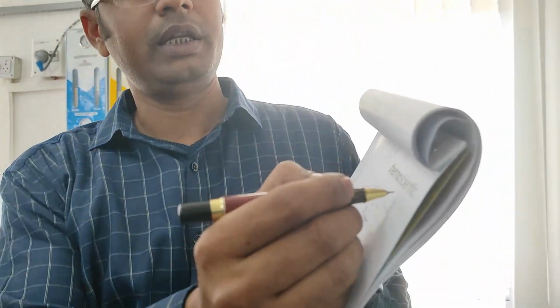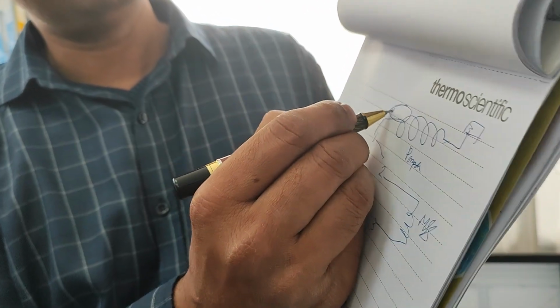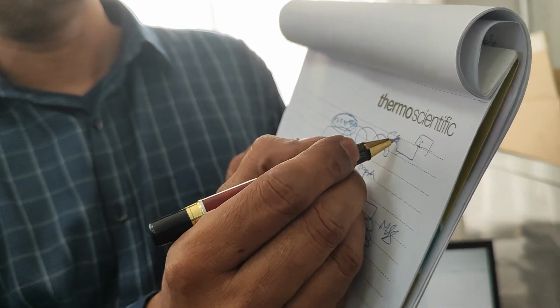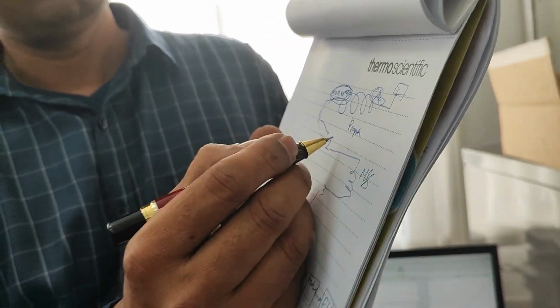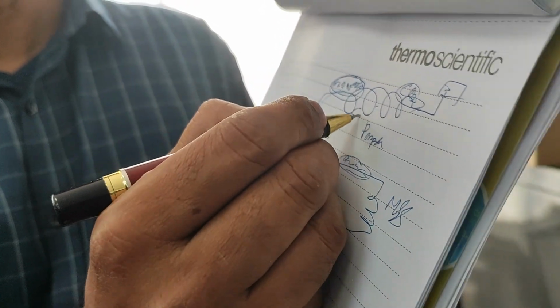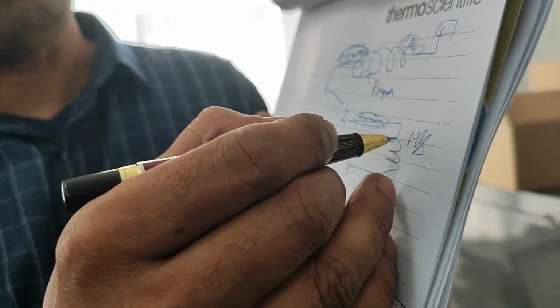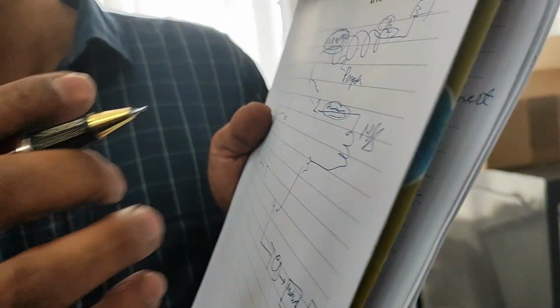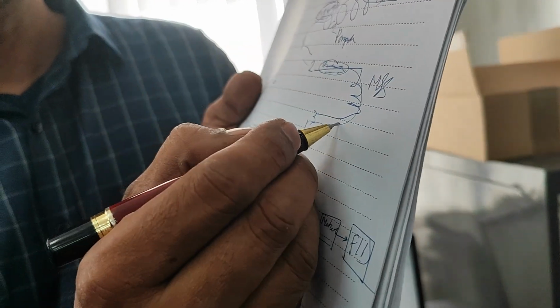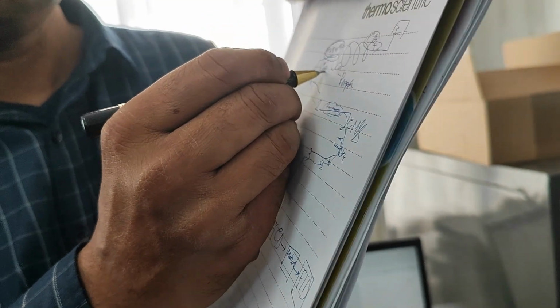So in this system, the combined hydrogen, O2, N2, CH4, CO will move as a packet and CO2 will come later on. Let them go. Here the packet of H2, O2, N2 and others, and CO2 will come here. Let them go. Hydrogen will move very fast. If this column is very small in length, hydrogen will move here and give a peak in the TCD. Then the other gases O2, N2, CH4, CO and CO2 will now come in.